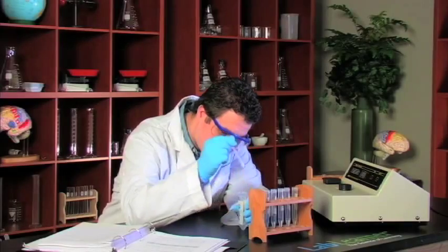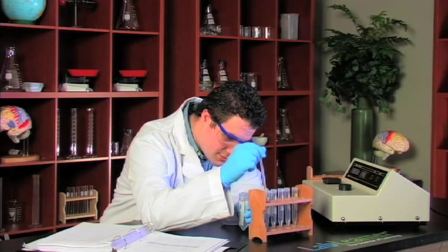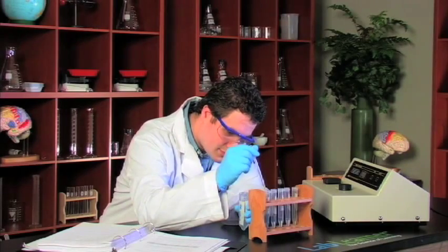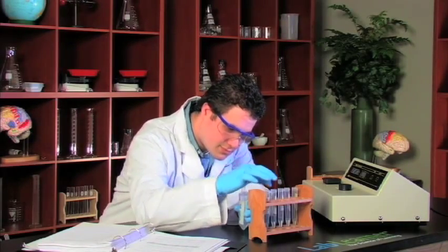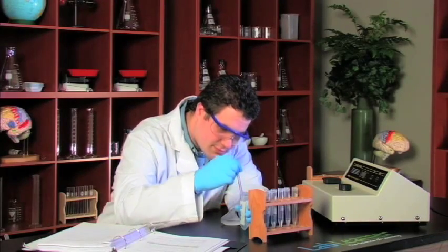Students may comment that the acetone smells like something that's very familiar, and if they think about it they'll probably decide that it smells like fingernail polish remover. Most of the fingernail polish removers that have been used for years consists mainly of acetone.